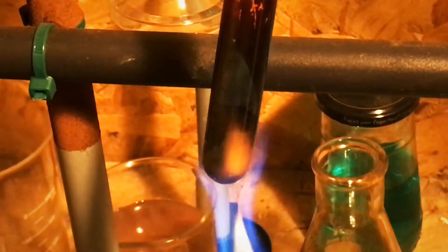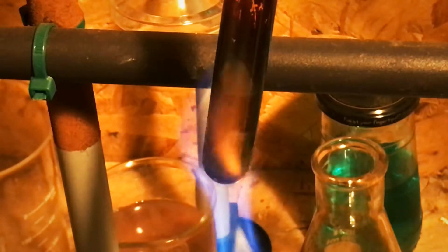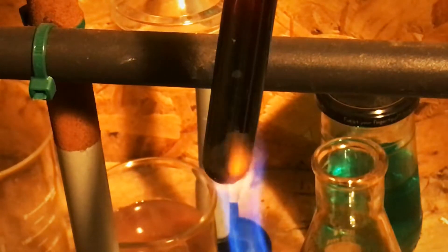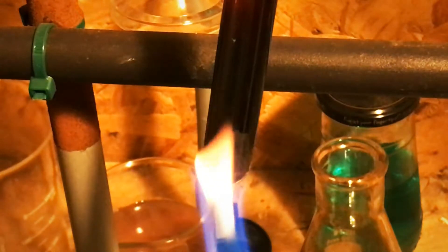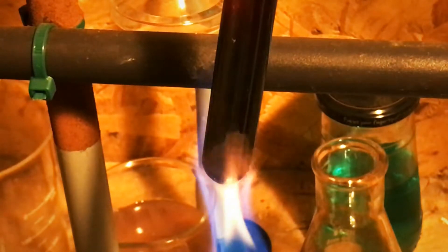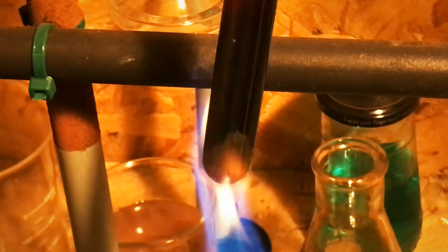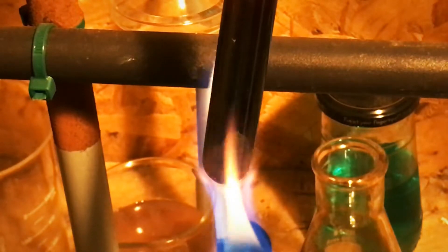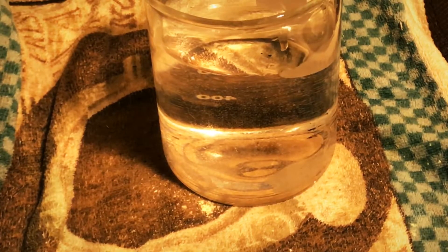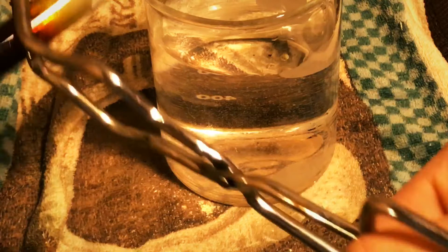What we have here is molten sulfur. Sulfur right now is being mixed with the oxygen in the air, creating sulfur dioxide. I am going to pour the molten sulfur directly into the cold water.